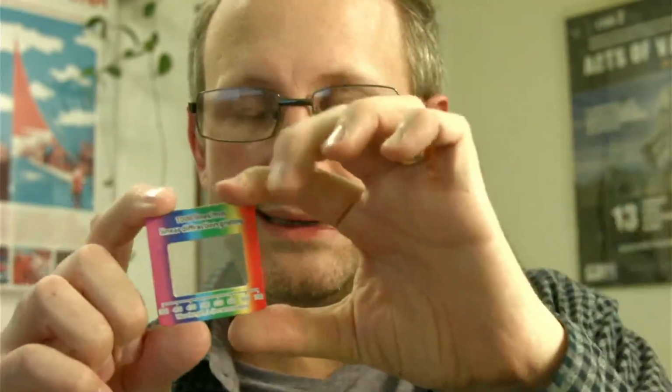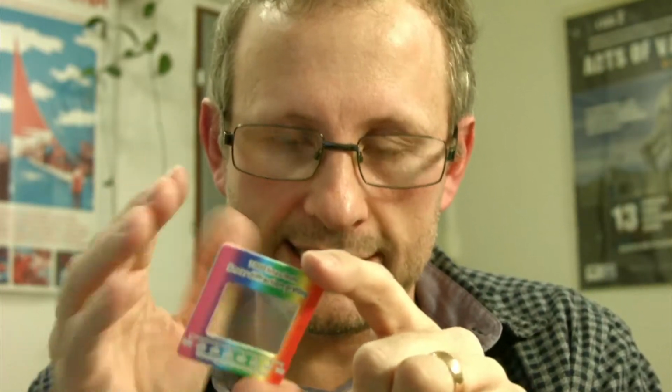Now, these are very cheap. You can get them on eBay for about, I don't know, $3 or something. And it seemed like quite a good way to go. You build a little box and a slit and so forth, and you get the light going onto your webcam or the camera inside your phone. And there's free software out there to use with this.